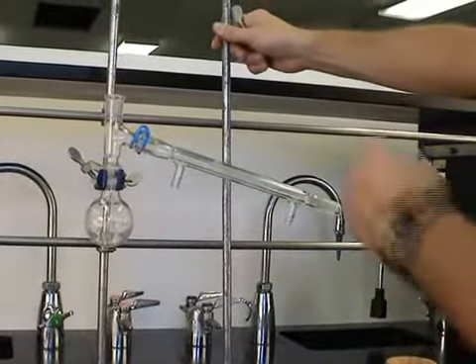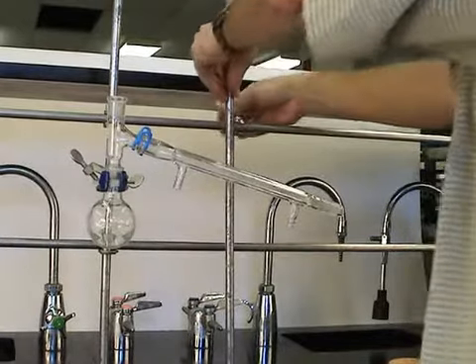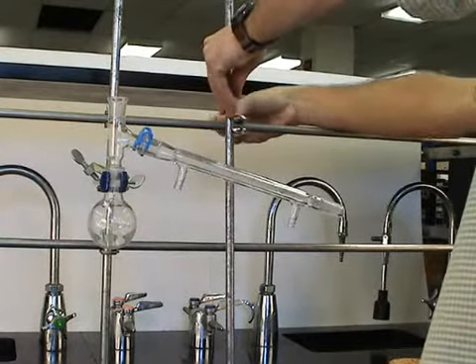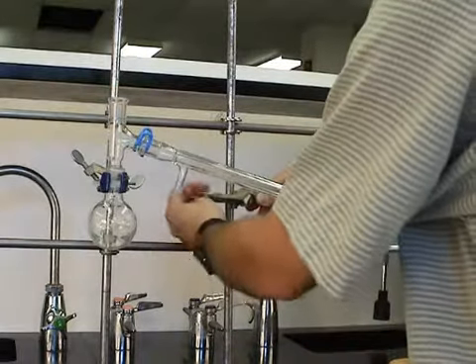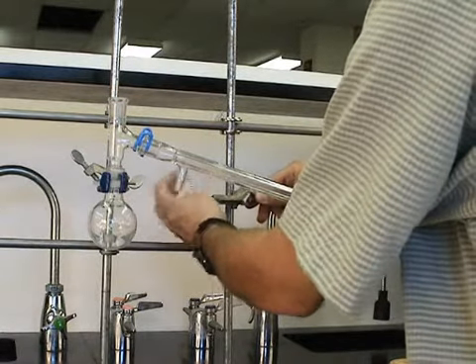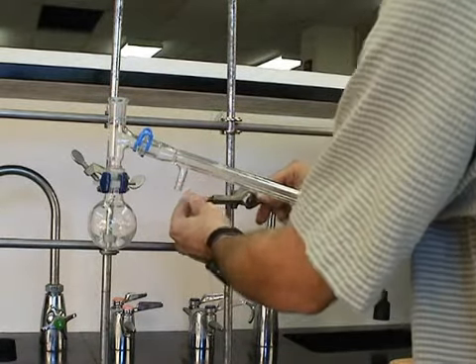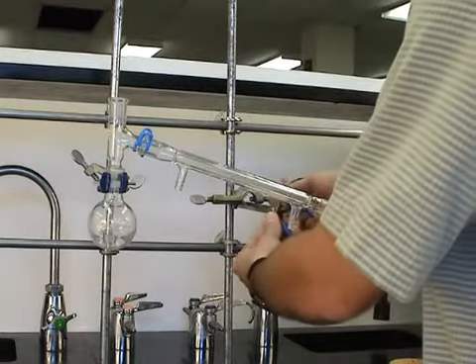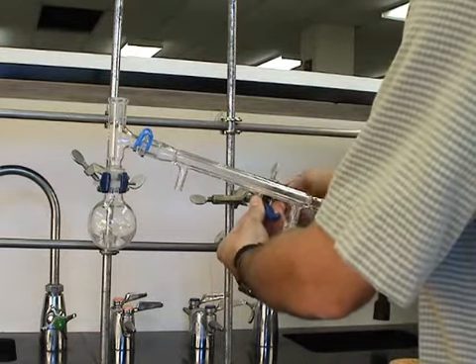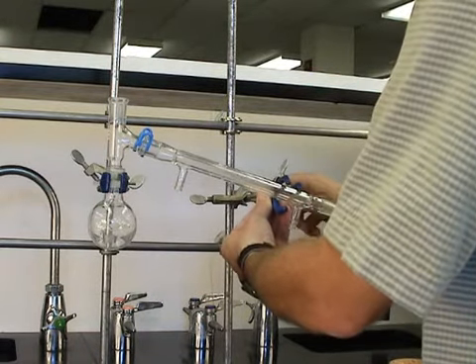With the condenser in place, we can now position a second aluminum rod. Again, using hook clamps positioned with the thumb screws behind. A second clamp holder is put in place. We're going to move that in a minute. And then a condenser clamp. Notice the three prongs at the end of the condenser clamp.